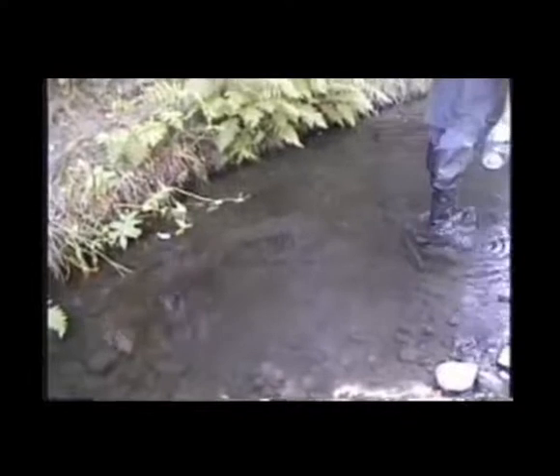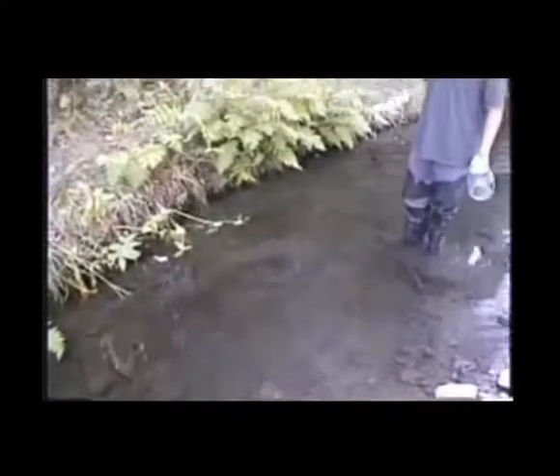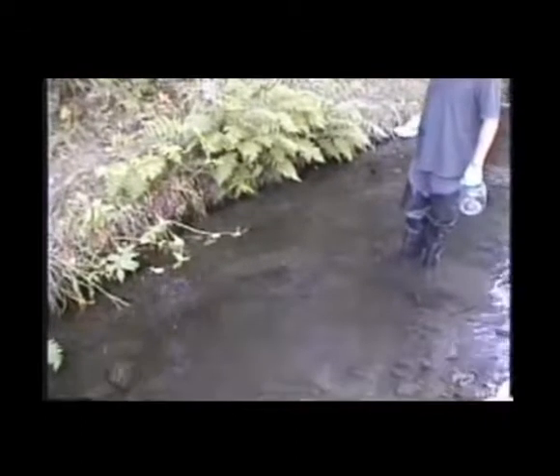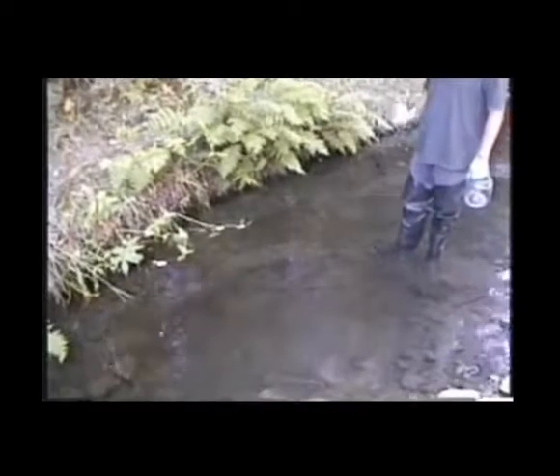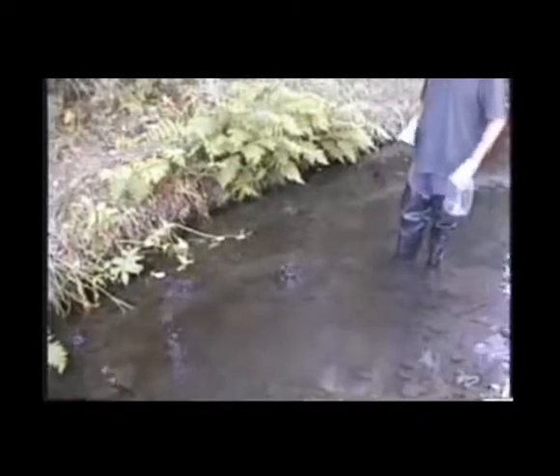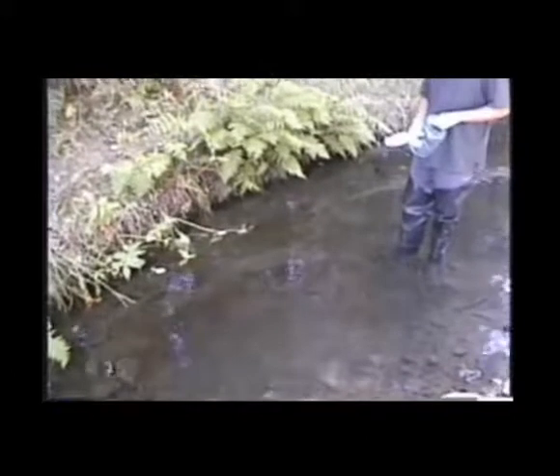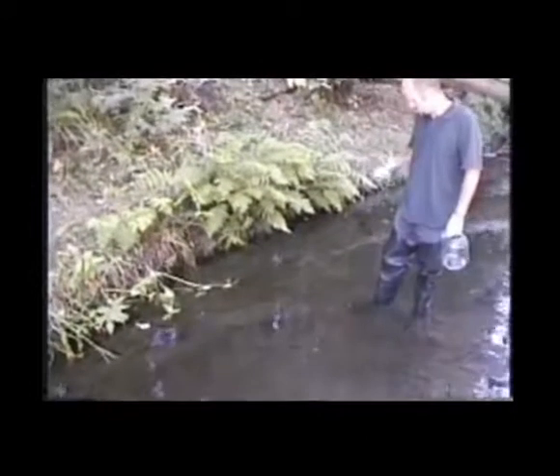For sediment collection, we found a desired spot that has fine sediment with a silt clay grain size fraction. And now, ideally, we want to collect the top 2 centimeters of the sediment, and we're collecting it here in a homogenizing jug. For later, we will aliquot into smaller jars.